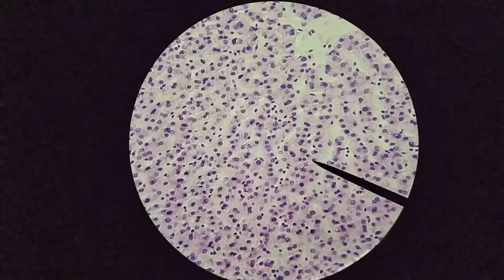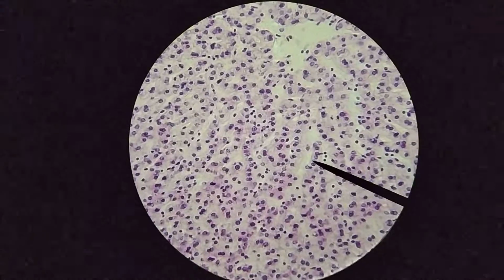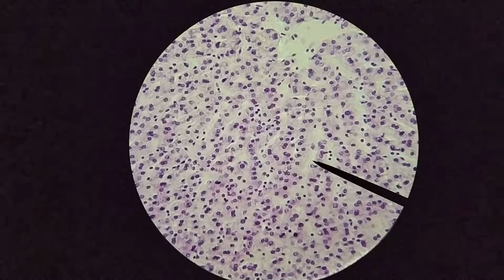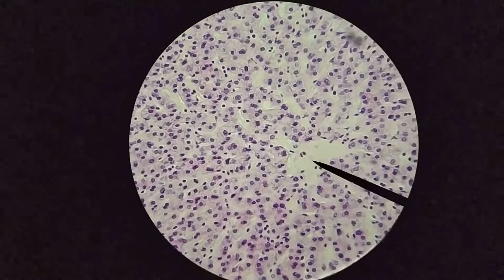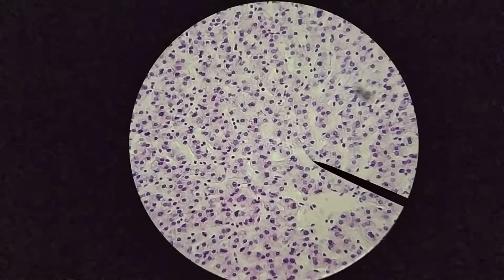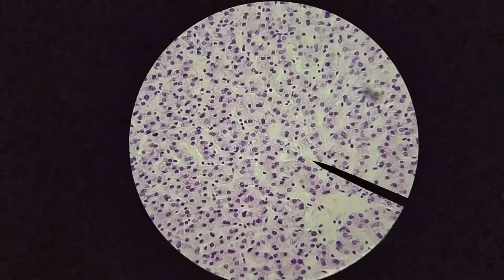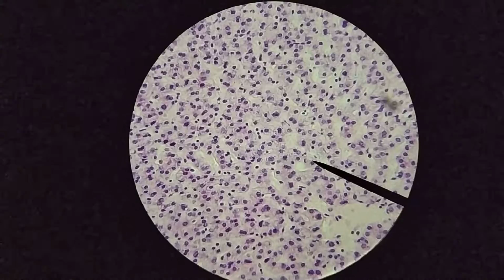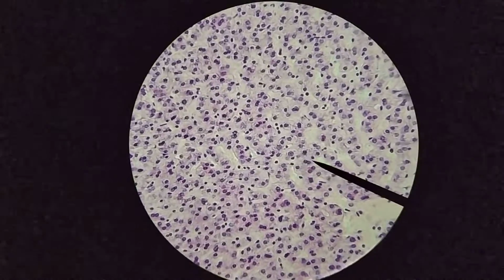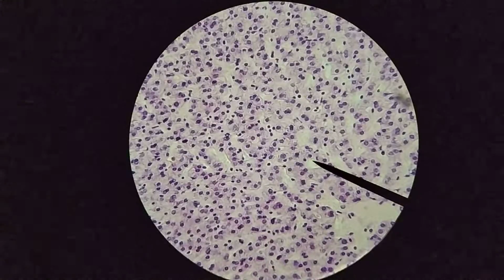Okay, so this would be one of the hepatic plates. And then this region right here looks kind of empty. That would be one of those sinusoids. And this all leads into the central vein here. Okay, so again, here's another sinusoid. Here. And another one, kind of a more of a cross section through one over here as well. Okay, so we have some sinusoids visible here.